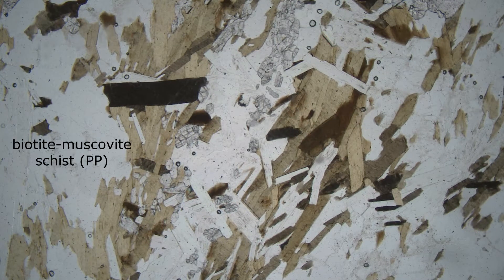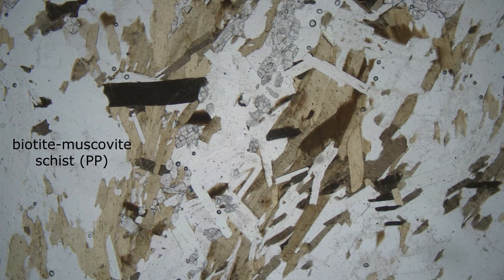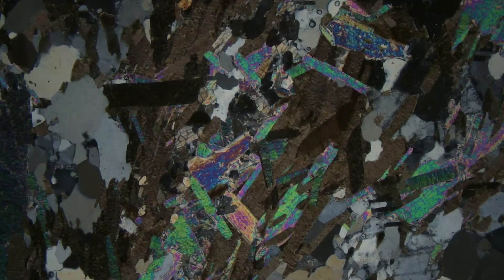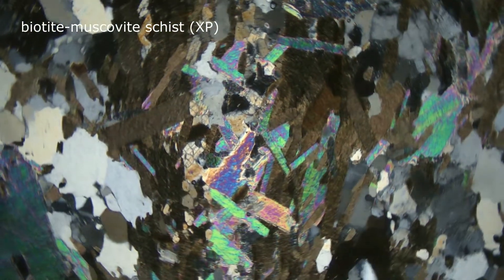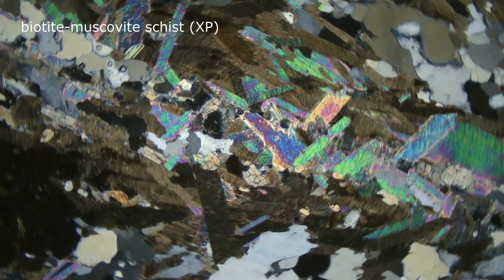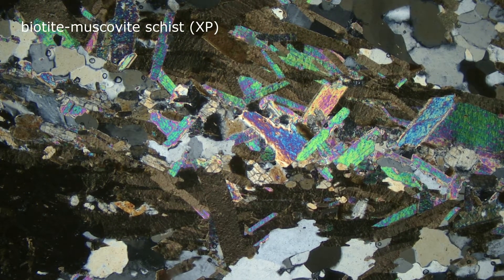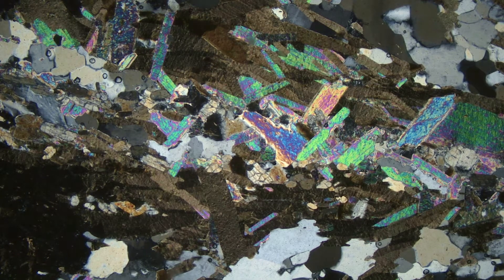Here is a view of a biotite-muscovite schist in plain polarized light. And here it is in cross-polars. Notice that the muscovite gives quite high-order interference colors — bright pastels. And the biotite has pastel interference colors, but the brown color of the grain makes them almost impossible to see.